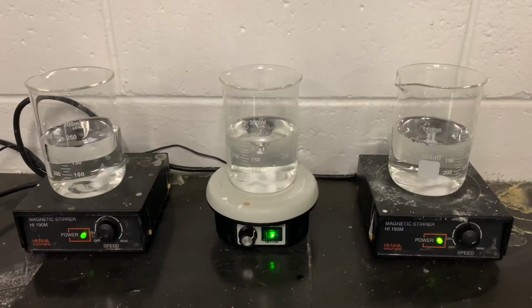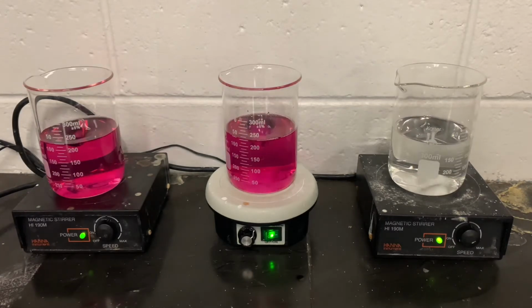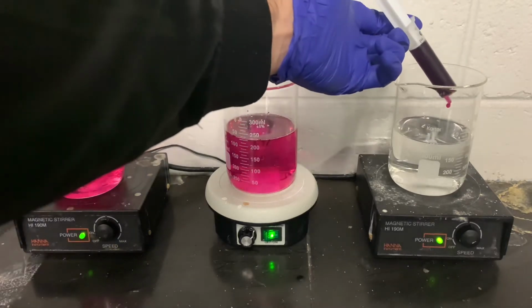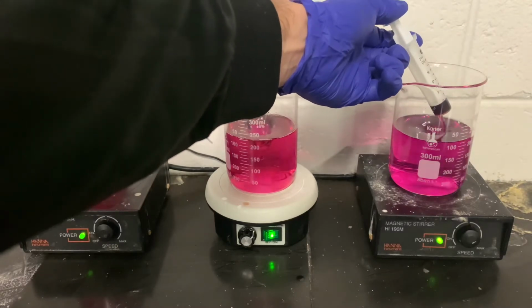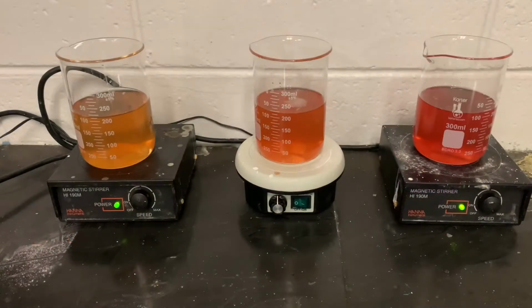Here we have all 3 samples, 200 mils each, ready to go. First 2 jars are dosed. And now I'm just taking my syringe, aiming at the side of the vortex, and quickly releasing all of the permanganate into the 3rd jar. After 15 minutes of mixing, we can see 3 different colors on the 6, 8, and 10 part per million samples. The sample on the far left has no pink left, so most likely all of the permanganate was used up, and it's either the correct dosage or underdosed. And we see the far one on the right, the 10 part per million sample, has quite a bit of pink left, so it's probably overdosed.